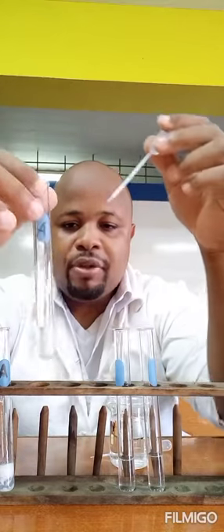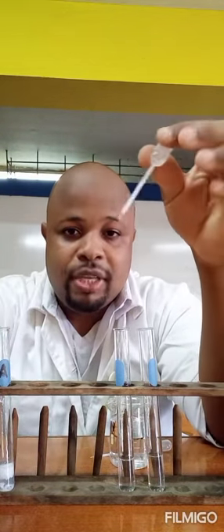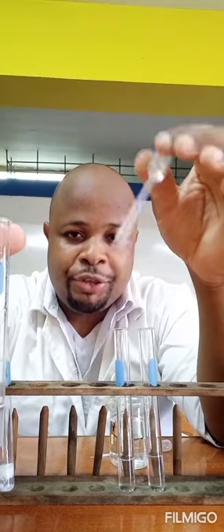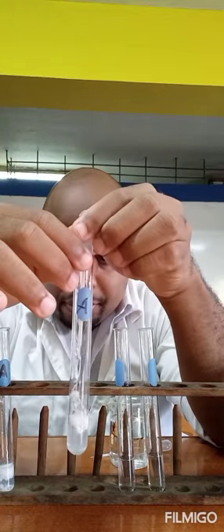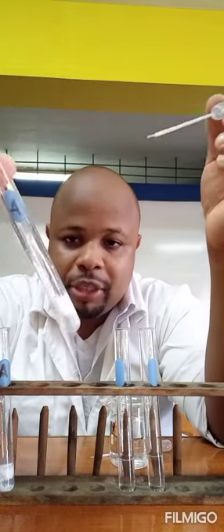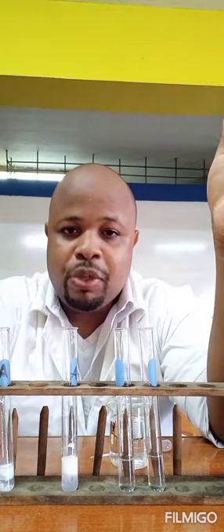So for the next sample of A, I am adding a few drops of ammonium hydroxide — aqueous ammonia. And I get a white precipitate. Now, if I get a white precipitate with ammonia, again it's a colorless solution, so the colored ions are out of it.